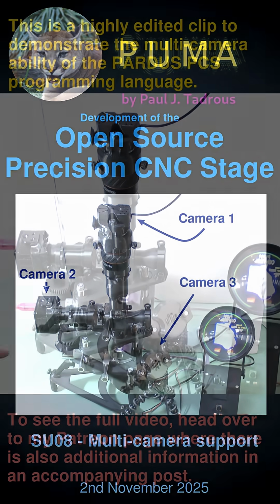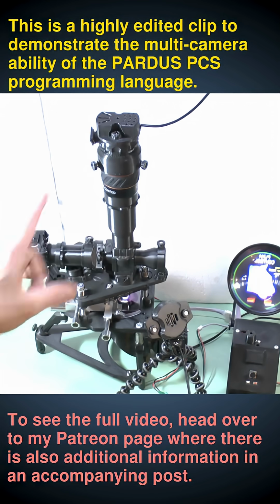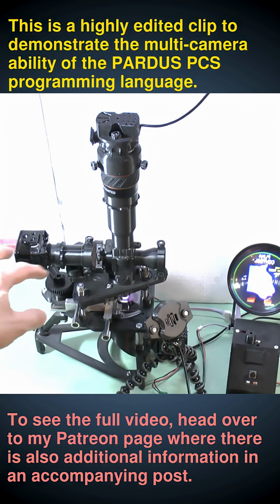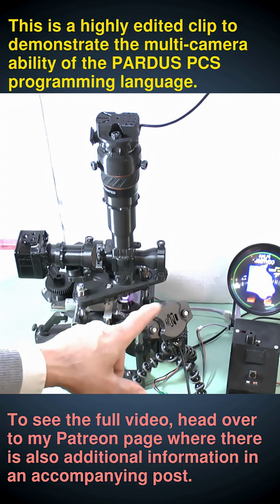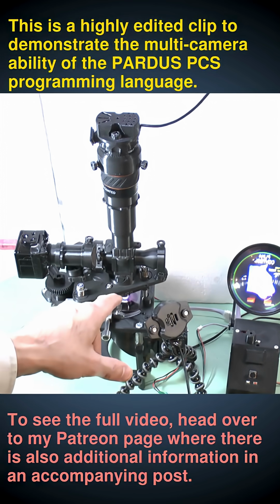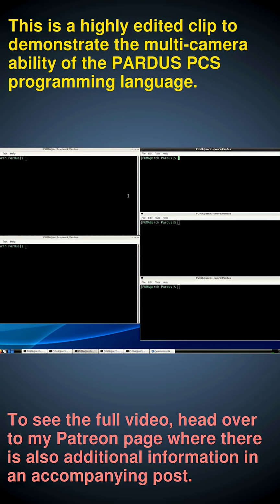So for this experiment, I'm using the manual PUMA stage with 3 cameras, where you have autofocus with a dedicated camera to do the autofocusing, low resolution so you get very fast image rates, and then you have your main camera to do your detailed observations and imaging in color, and you have the external camera because you're not present in the room, so it's useful to have a camera to look at what's going on on the stage. So now I'll demonstrate the updated software that allows you to use multiple cameras.